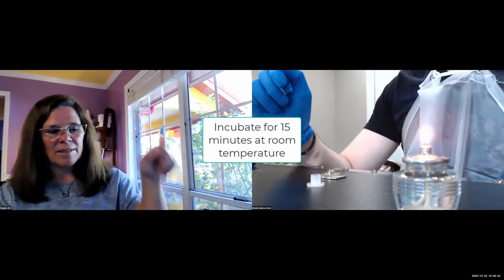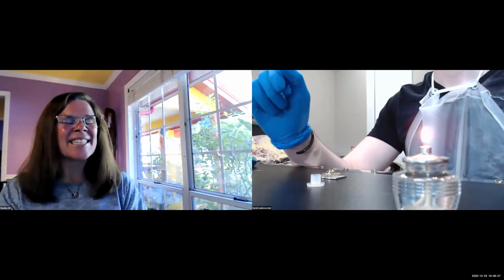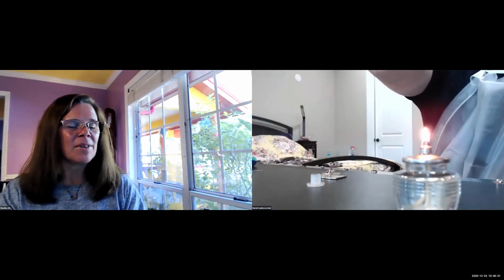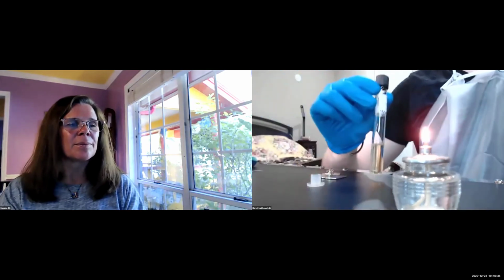Now 15 minutes have passed. Fast forward. You take the liquid broth again and take a new transfer pipette.